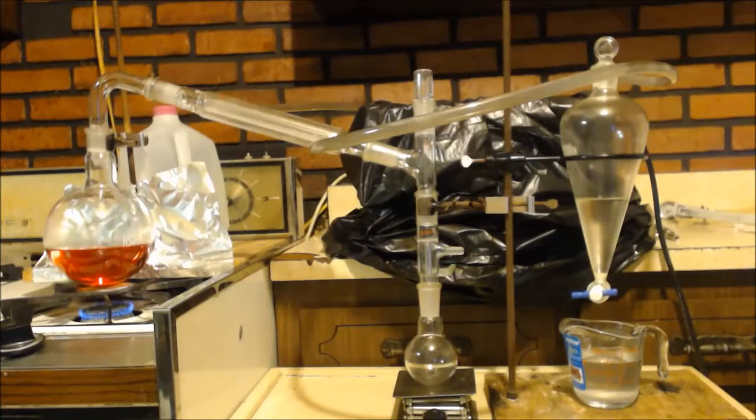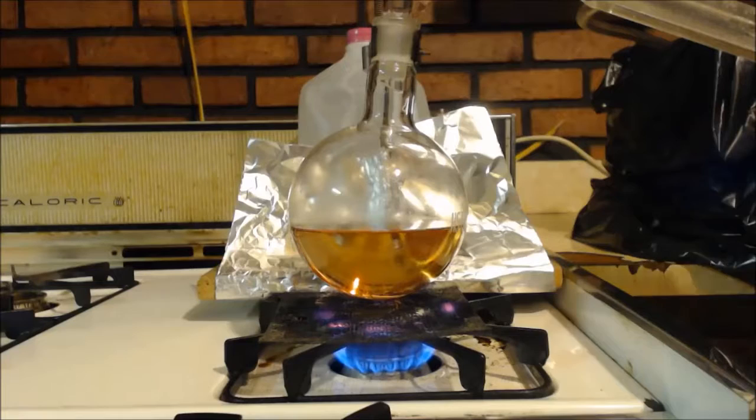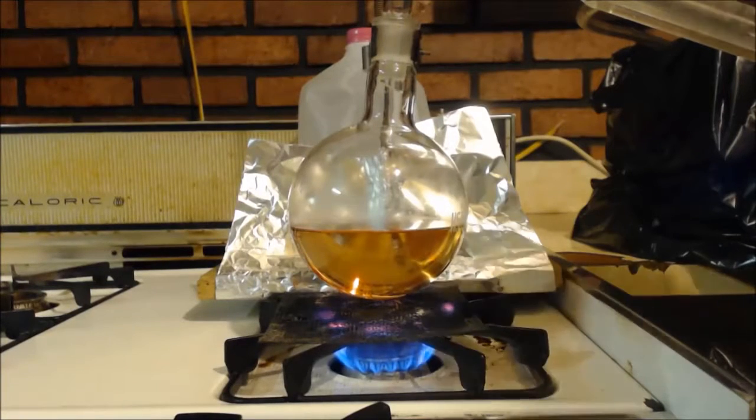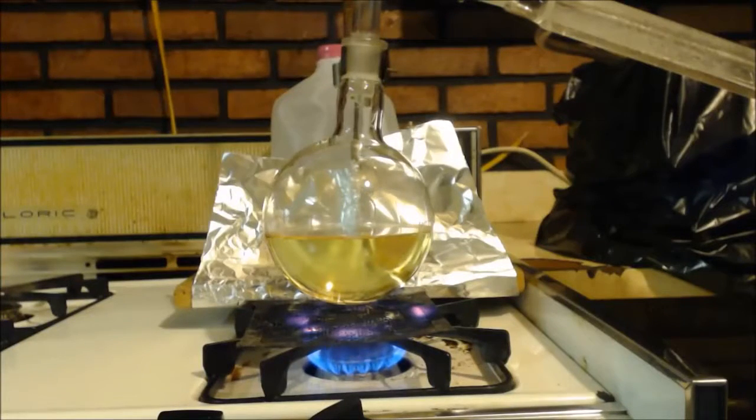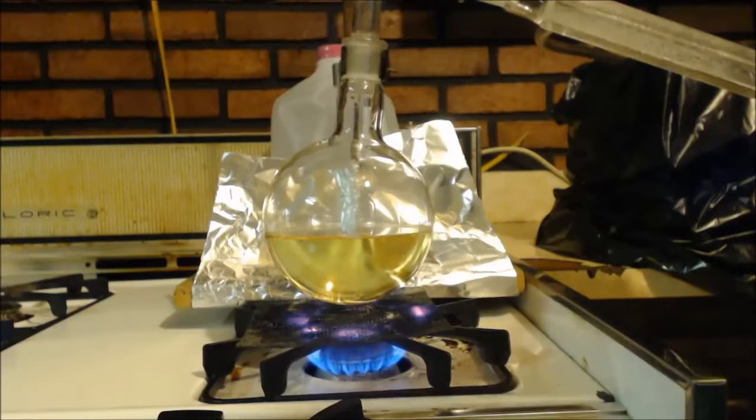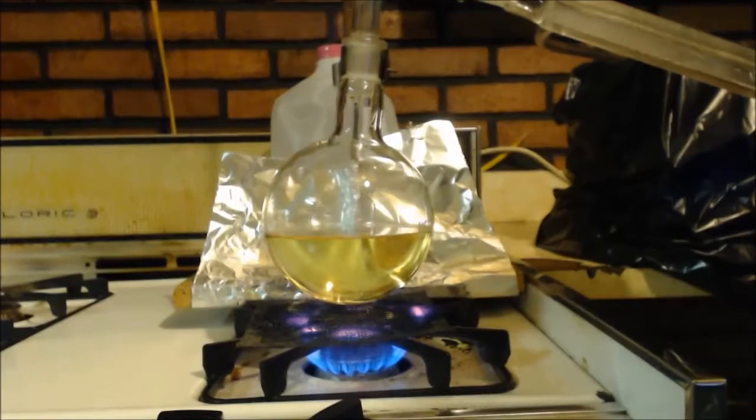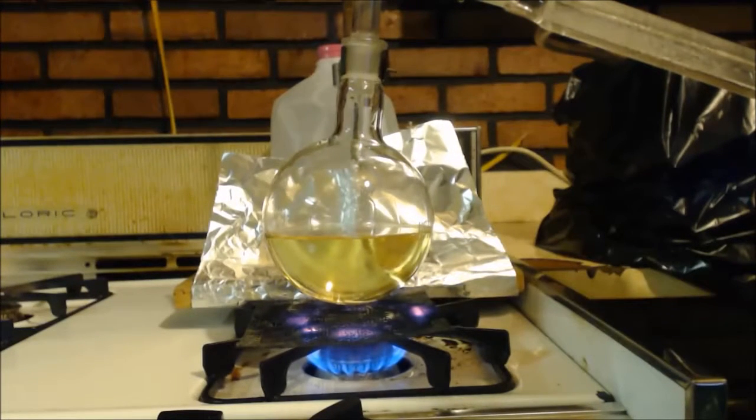Anyways, this takes forever to heat up. So when it starts heating up, I'll show you how it changes color. You can see it's only up to like 170C. It's turning like an orange lighter color. It'll be 195. Well, you can see it went from pink to orange. Now it's yellow. It's almost starting to boil. This is under atmospheric pressure. No vacuum.